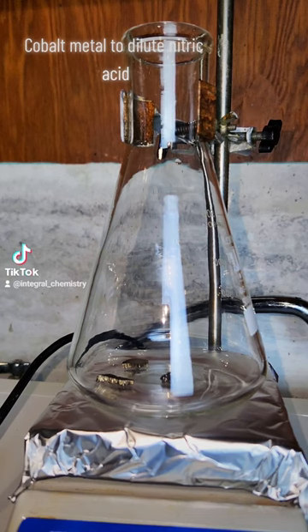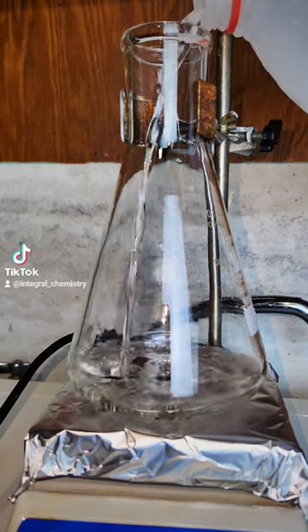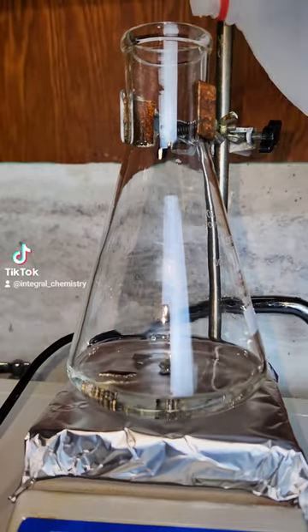Dissolving tin in hydroxide takes an extremely long time, so while that's going on, I add a second metal, cobalt, to an Erlenmeyer flask.